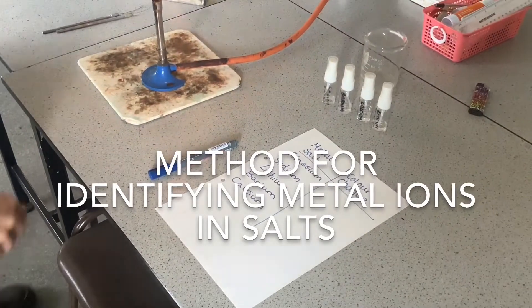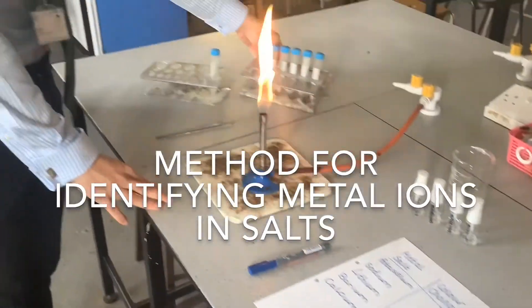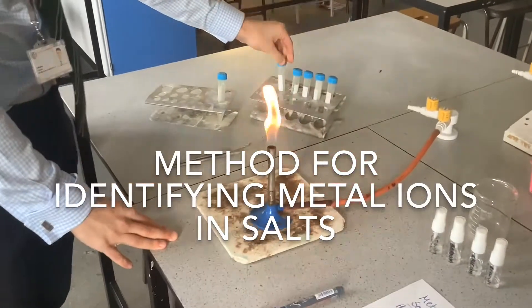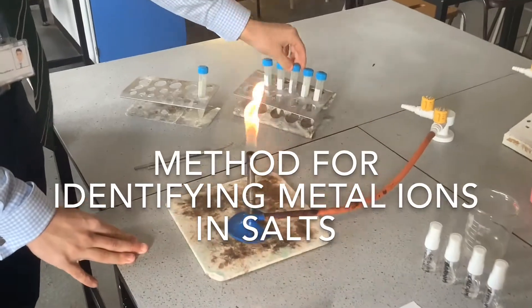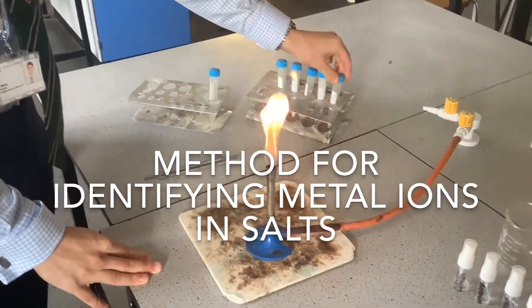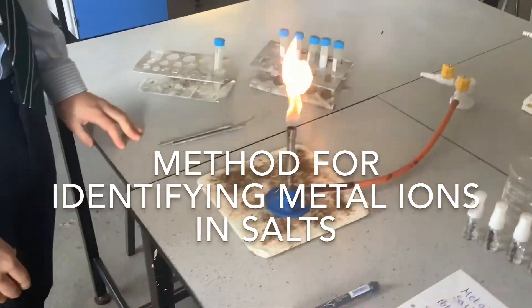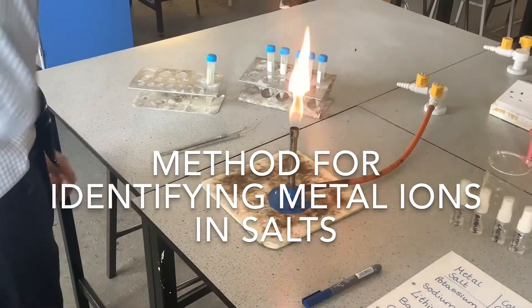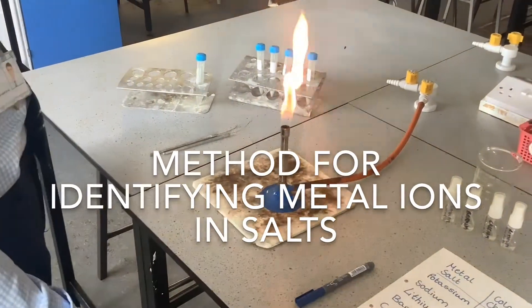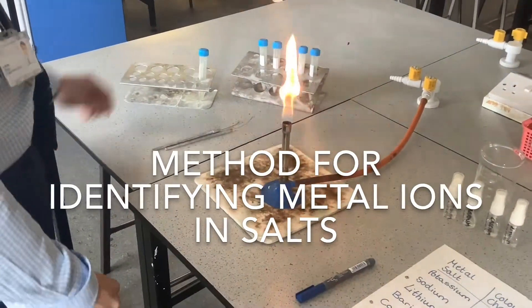I've got potassium, sodium, lithium, barium, and calcium, and then a selection of five salts. What they could ask you is that you've got unknown salts and you would be using this method to find out the metal in them.